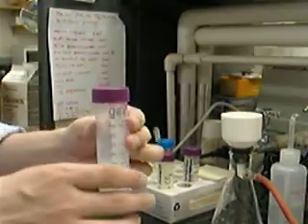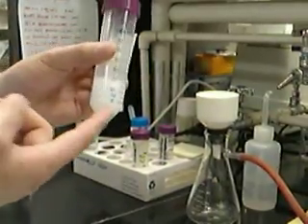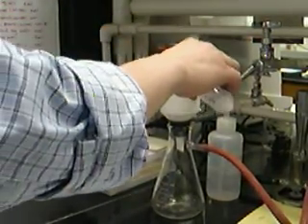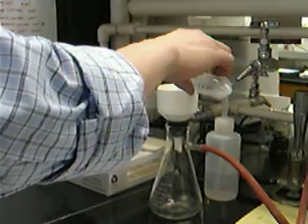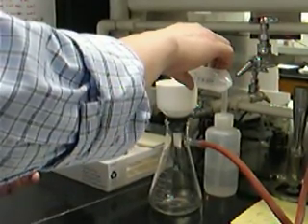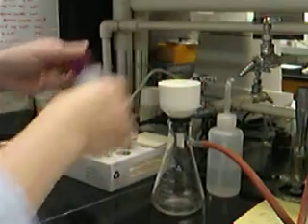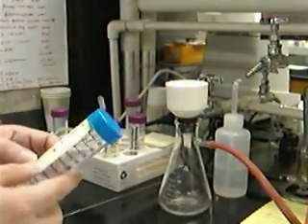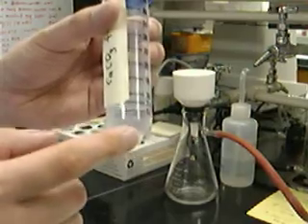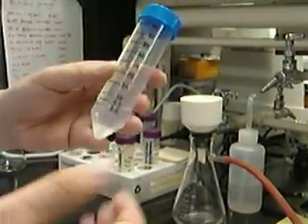After this step, what I'm going to do is use this filtering apparatus to filter out the calcium carbonate, which is the white stuff. I'll turn on the vacuum. This step is going to take a pretty long time, so I will let it continue. Here is the filtrate from the calcium carbonate precipitation — it's clear. The solution obtained from this flask is clear because the calcium carbonate has all been filtered out.